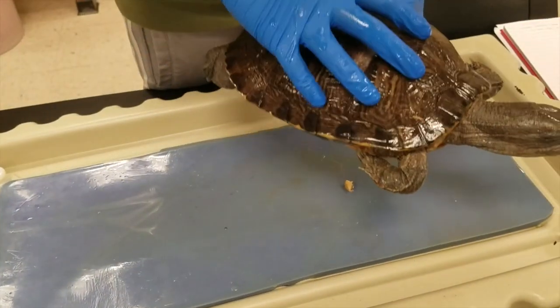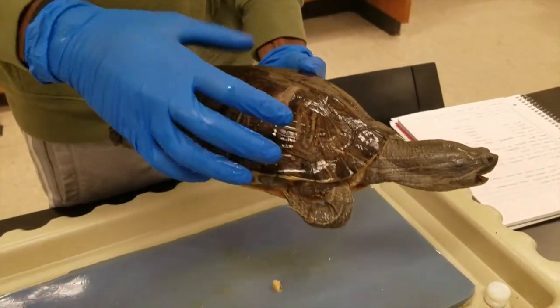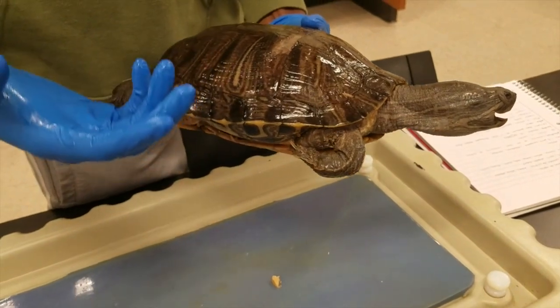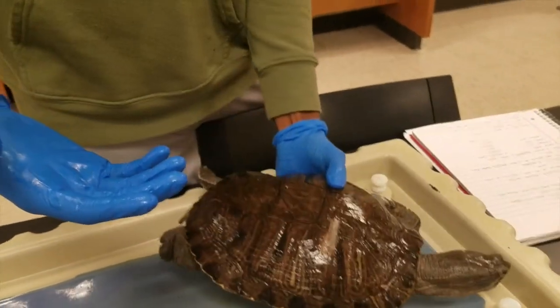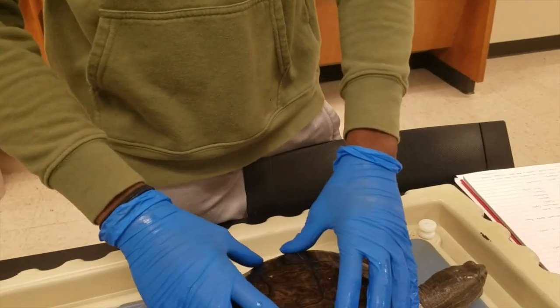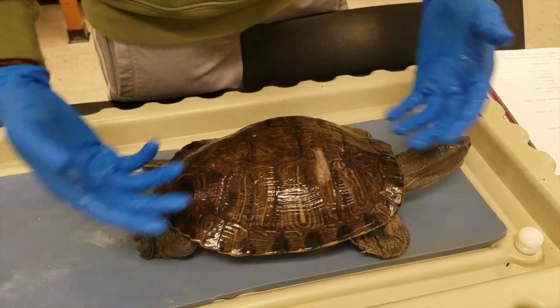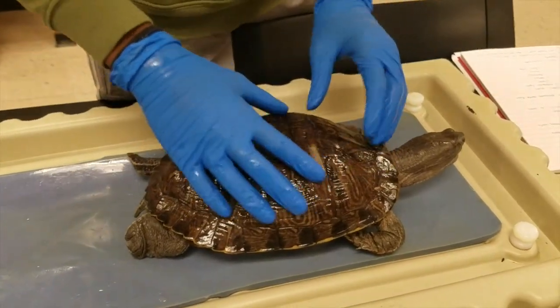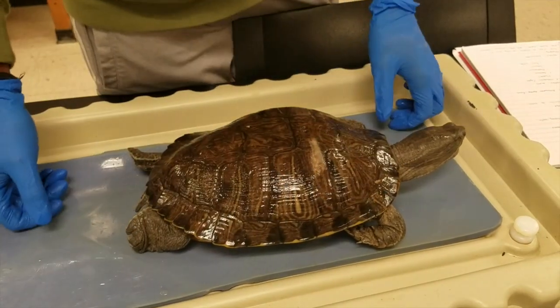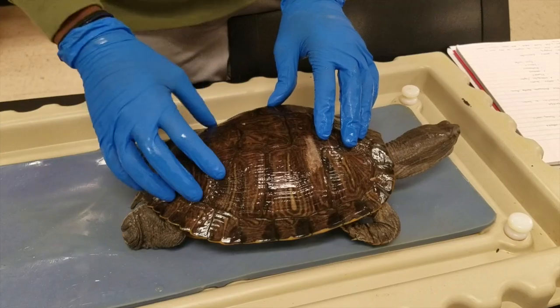One more thing about the shell is that it is a calcium and magnesium carbonate reservoir, which buffers the blood. This is important because it allows the turtle to survive in anoxic conditions, meaning it won't die of lethal acidosis from not taking in oxygen. It has been noted that turtles can survive at temperatures of three degrees Celsius without oxygen for up to three months.